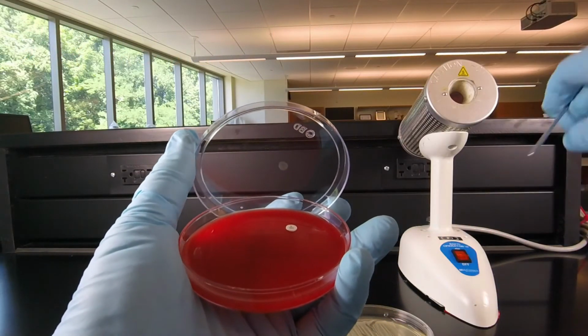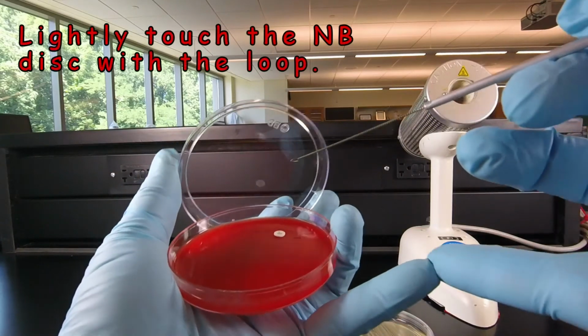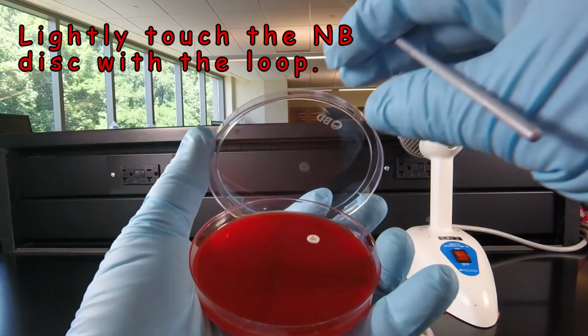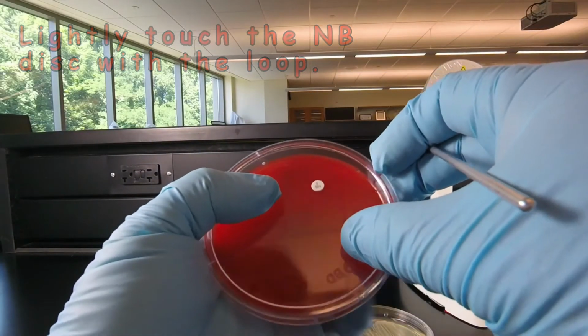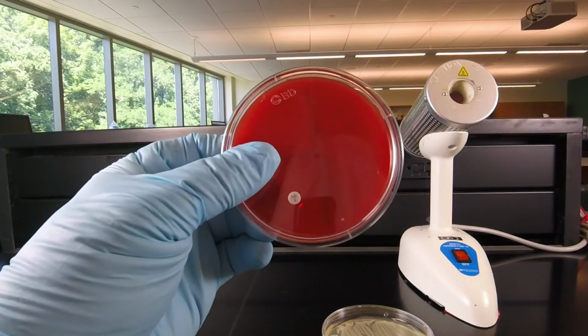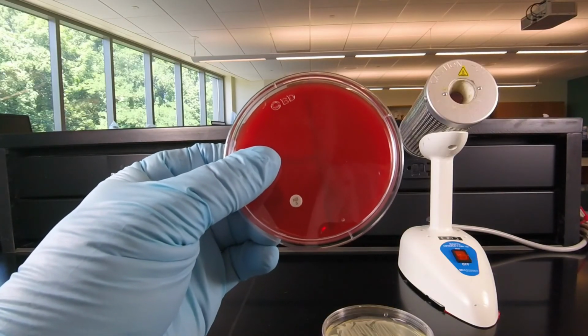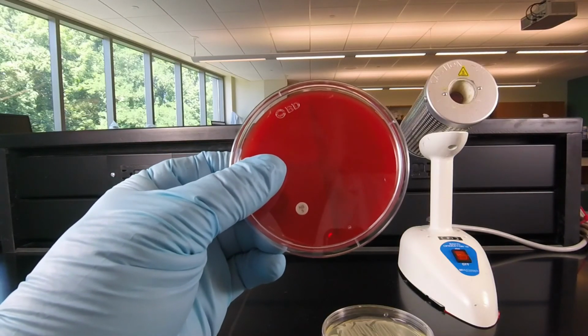Then we're going to take our inoculating loop and just gently touch the disc so it makes good contact with the plate, so that when we incubate the plate upside down at 37 degrees, the disc doesn't fall off. So at this point, we're ready to incubate the blood agar plate.